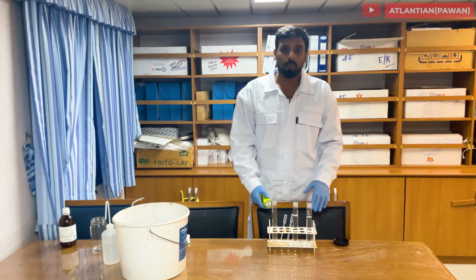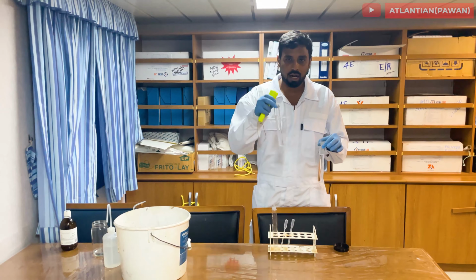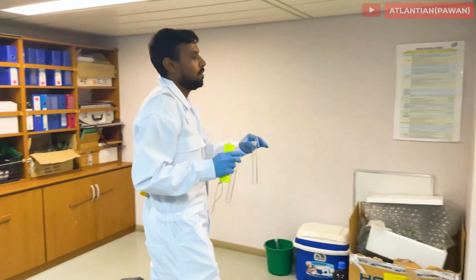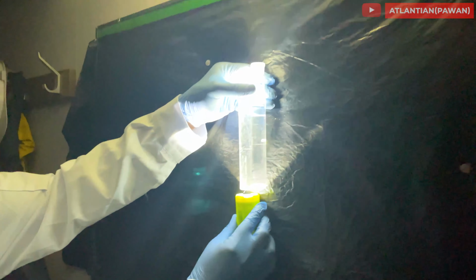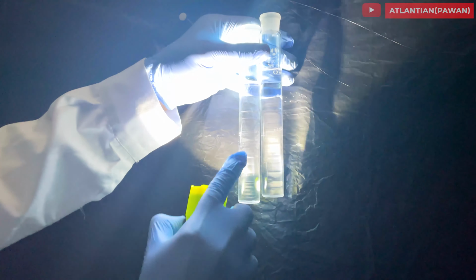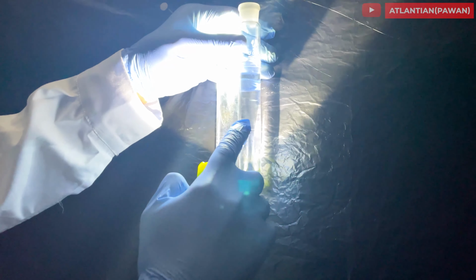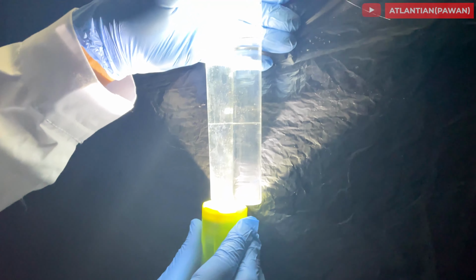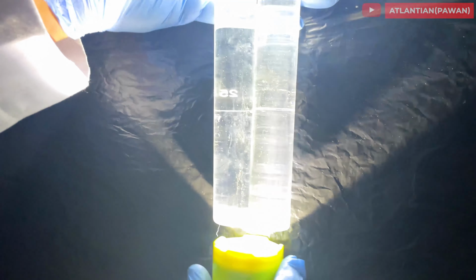So now 15 minutes have passed. Now we'll compare both our reference sample and our tank sample against a black background by switching off our lights. So this is my reference sample again, which we have made with pure methanol and pure DI. This is the tank sample, which we have taken from the tank, tank methanol and pure DI. So I'm passing the light through this. You can see it is crystal clear. There is no refraction or anything.